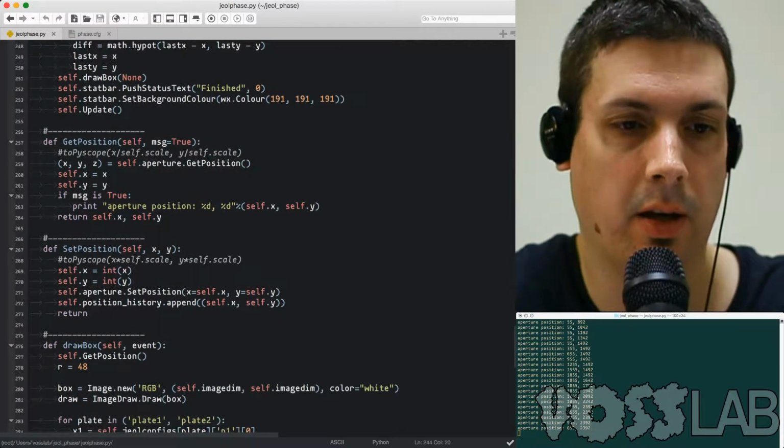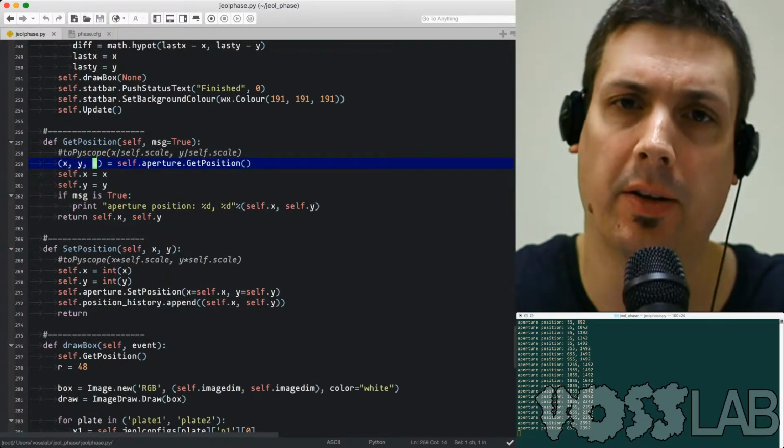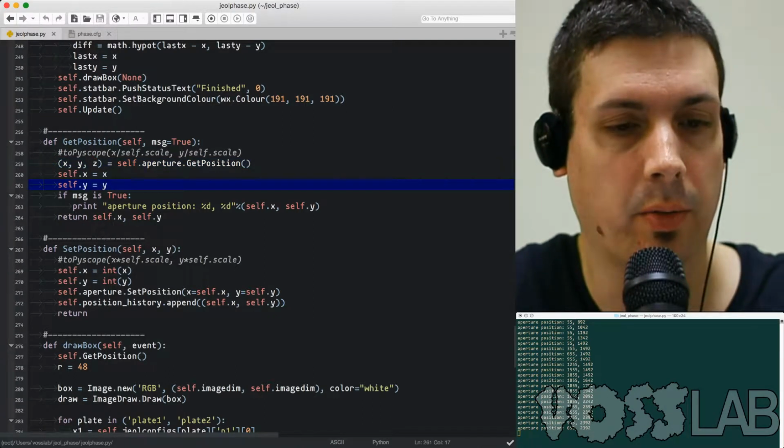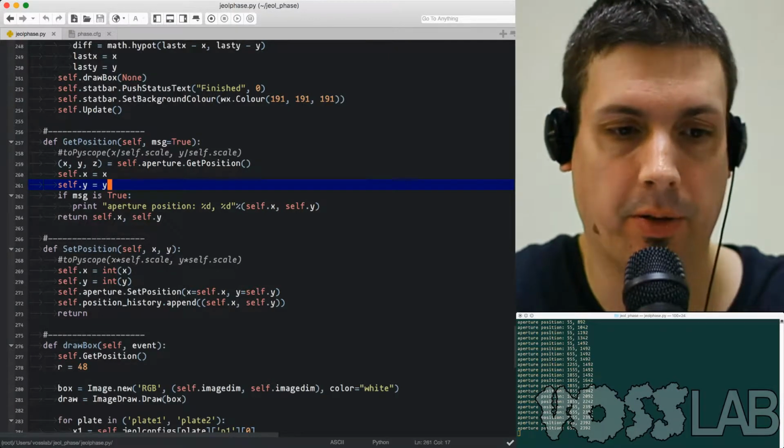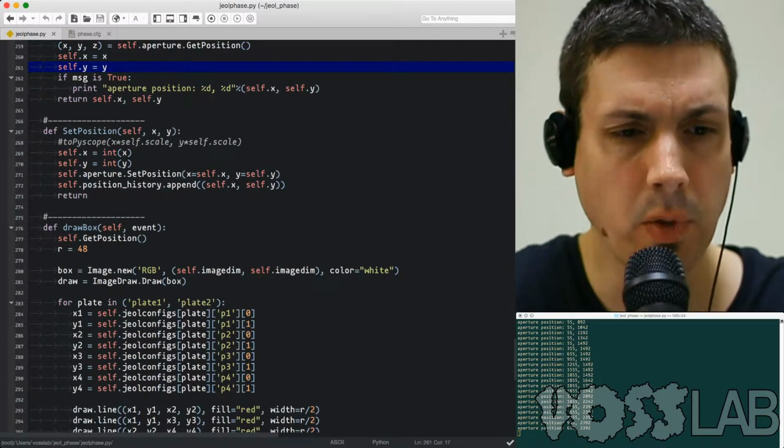Get position. When you get the position of the microscope, it actually gives you the Z, but I told it to kind of ignore that. Also, when you set the position, or send it to the microscope, you give it X and Y. I make sure those are integers. Drawing the box is simple.